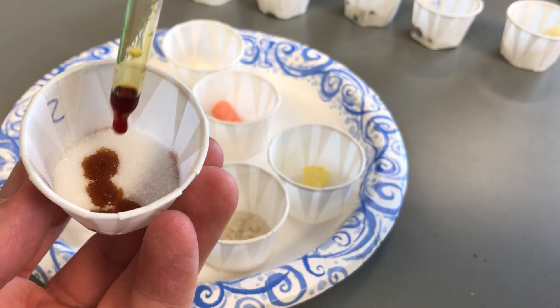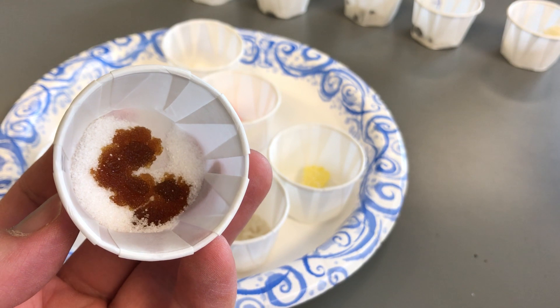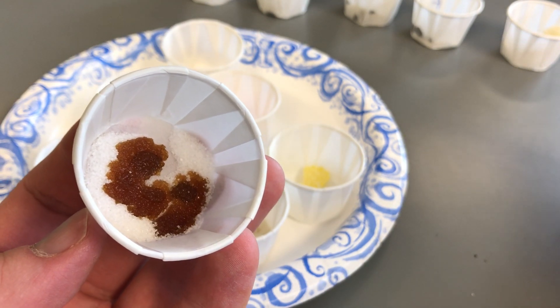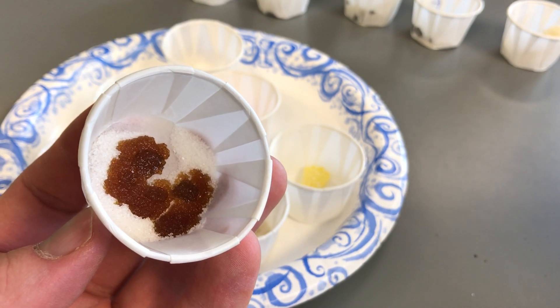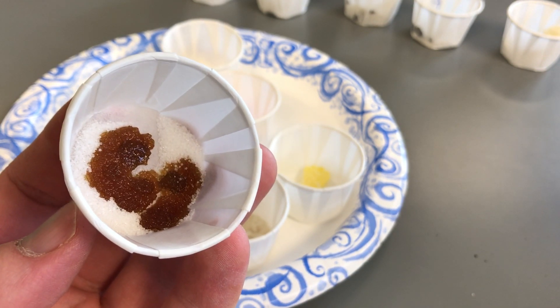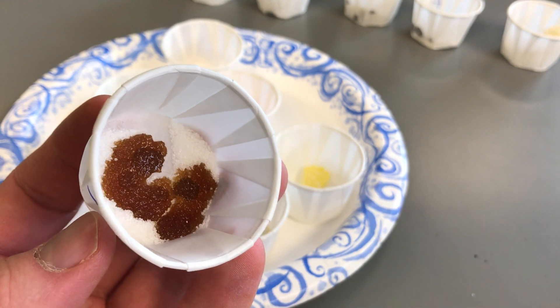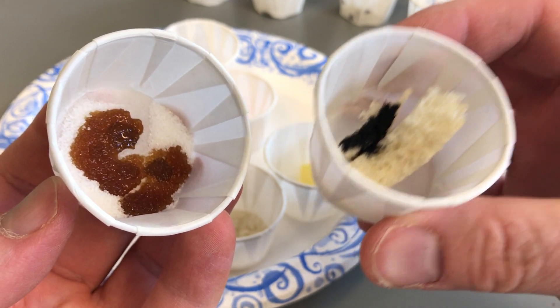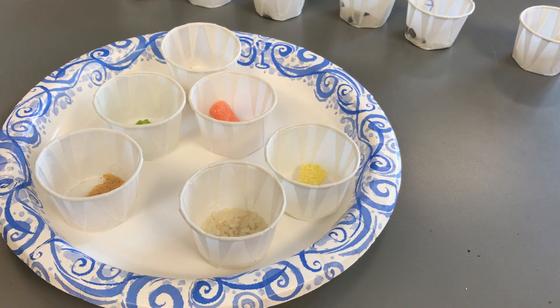Table sugar stays amber — no change to black. Table sugar is likely sucrose, a small disaccharide molecule. In dehydration synthesis, monosaccharides like glucose are bonded together by removing water to build a disaccharide. If you continue building those molecules over and over, they eventually become starch — a macromolecule, a huge molecule. That's why sugar and bread show up differently in this indicator test. Sugar is a negative result.